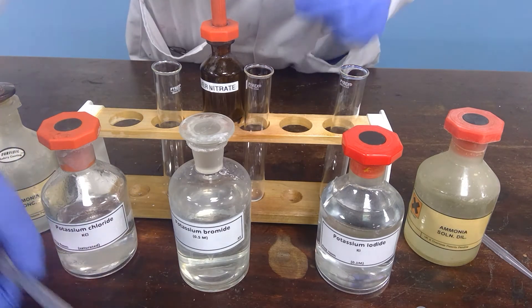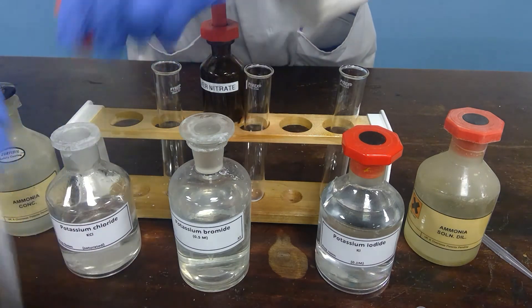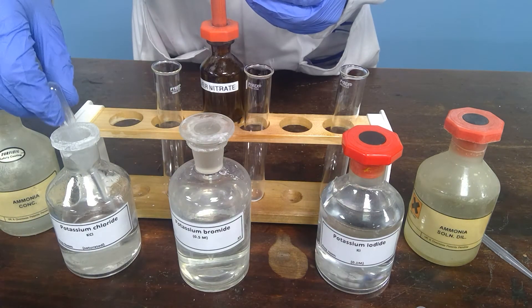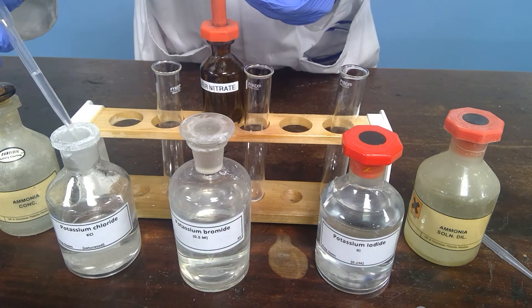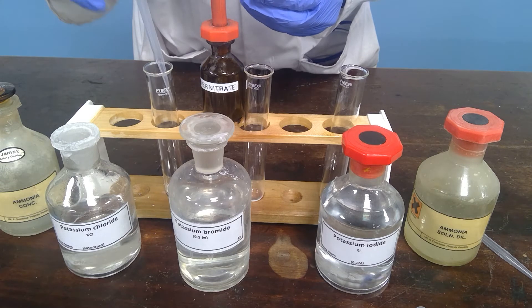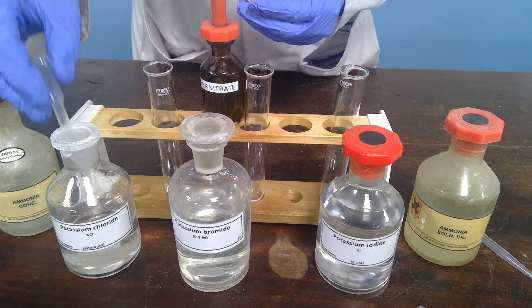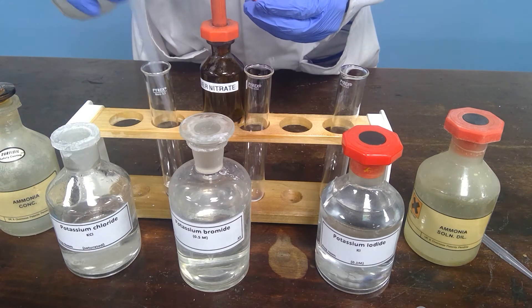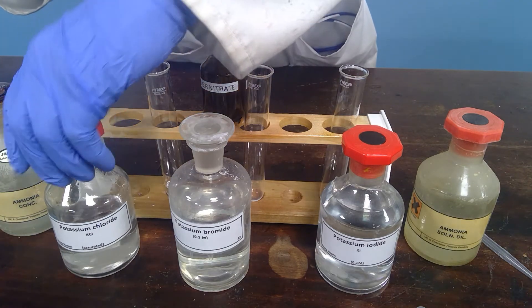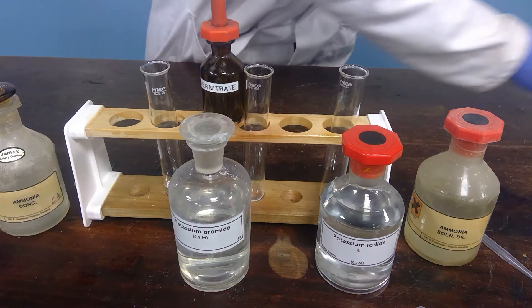So first we are going to add the soluble halide — potassium on all occasions here — to each one of these boiling tubes. So for you, this is the potassium chloride on your left hand side.